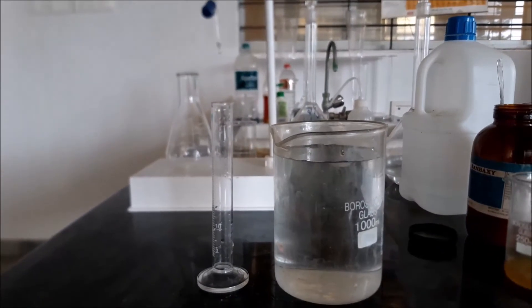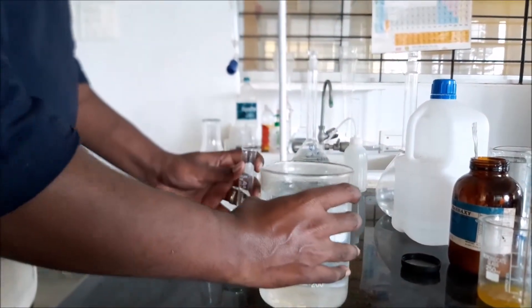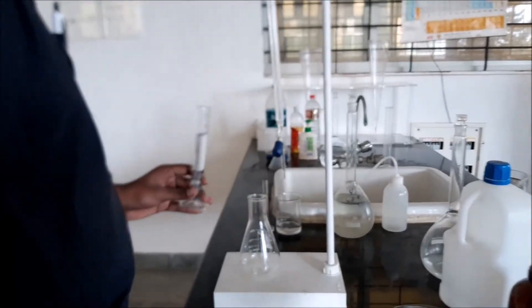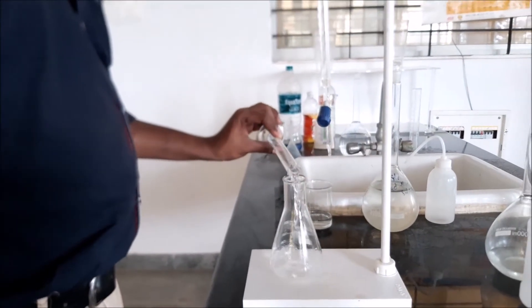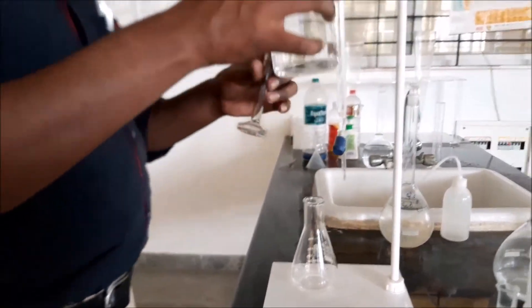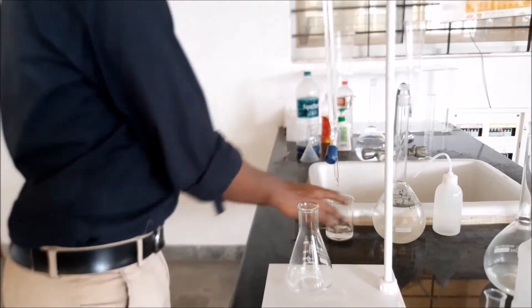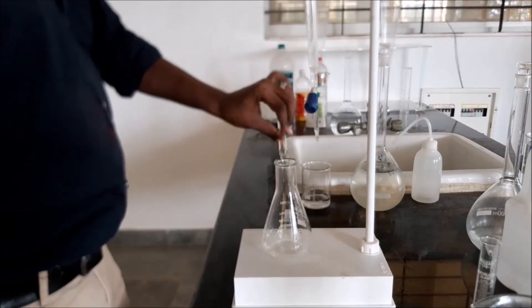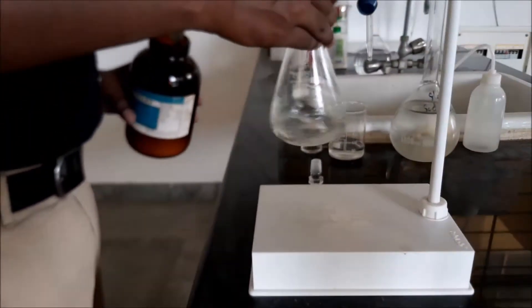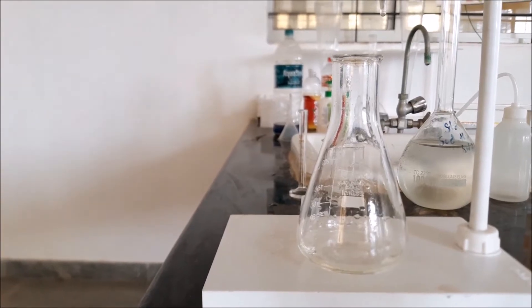We have taken sample four, to which eight ml of chlorine water was added. We take 25 ml of sample and add it to the conical flask. Two ml of acetic acid is measured and added to the sample, followed by a pinch of potassium iodide. There is still no change in color, signifying that the residual chlorine is zero. Note down the value as zero.